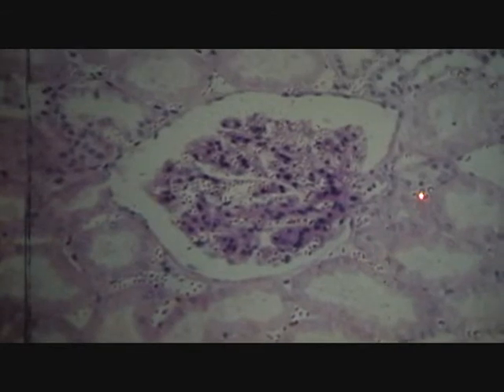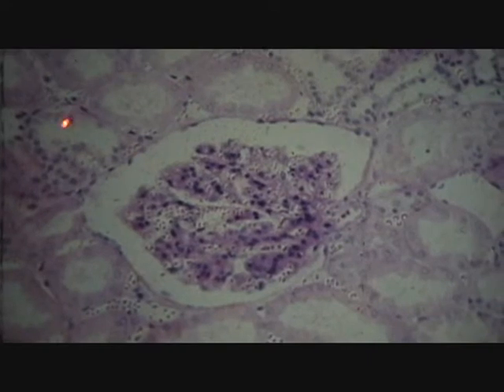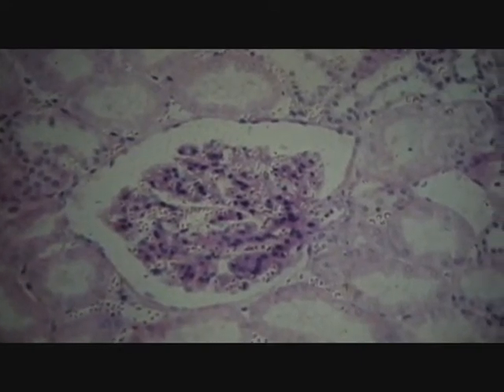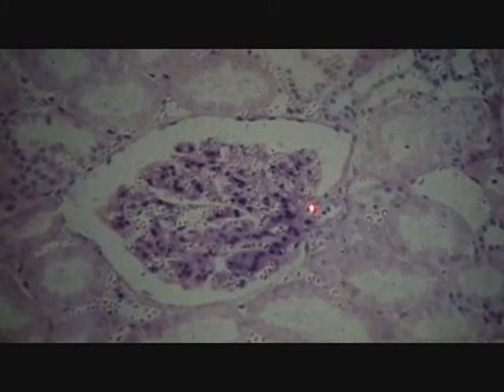Also for lecture, really good to see how those red blood cells are everywhere. These are the capillaries that are in constant association with the uriniferous tubule, all throughout the nephron. And it's really important for lecture that you always invoke uriniferous tubule in constant association with vasculature.